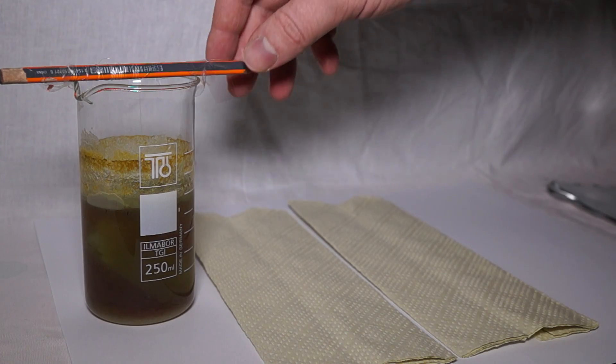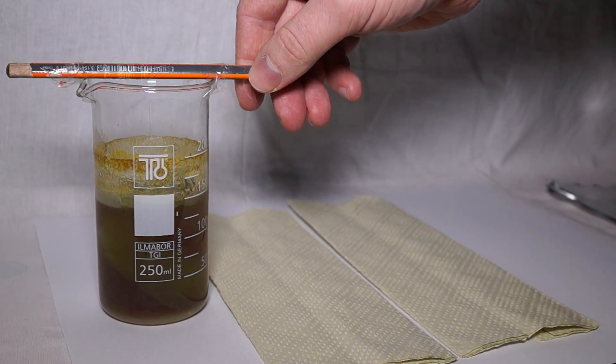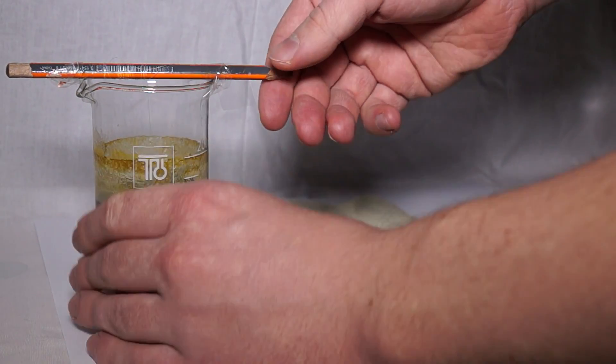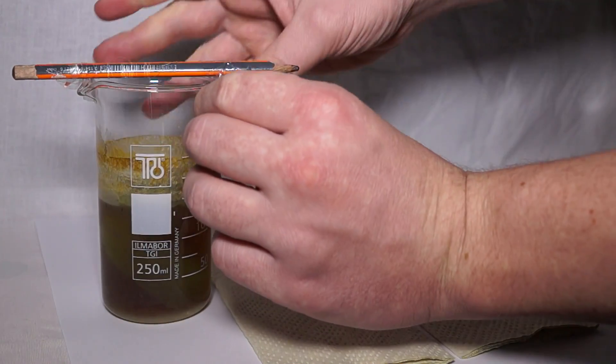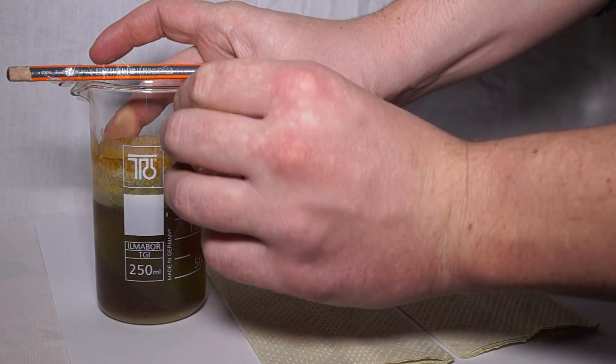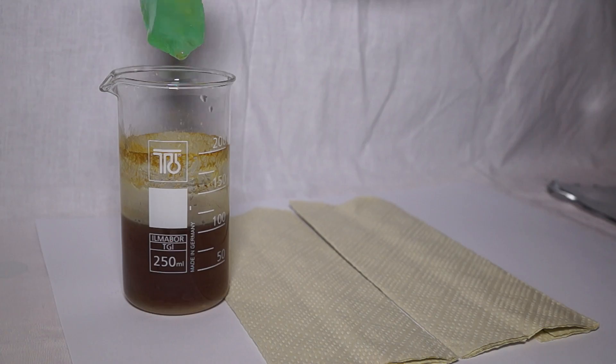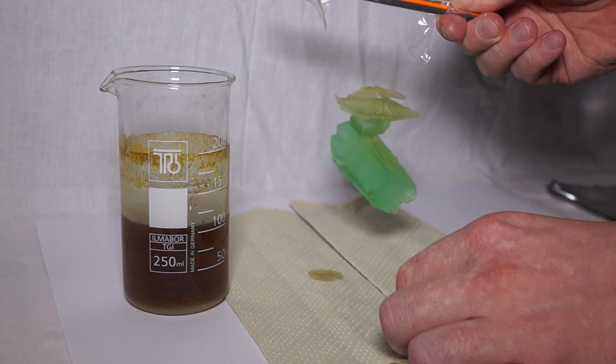After about two months, my crystal has grown enough and I decide that it's okay to stop its growth. I also had a crystal grown in a smaller cup. Now I'm pulling the crystal from the solution.